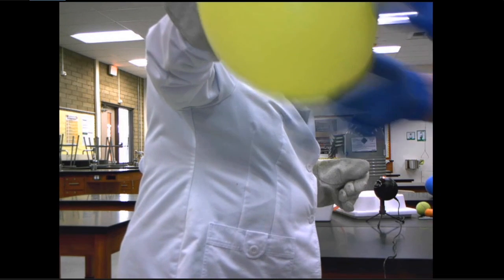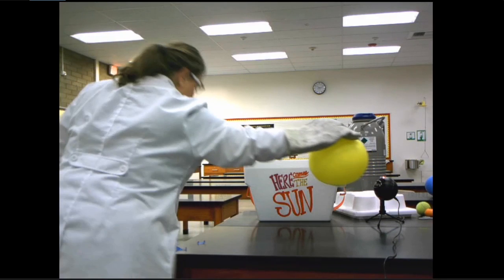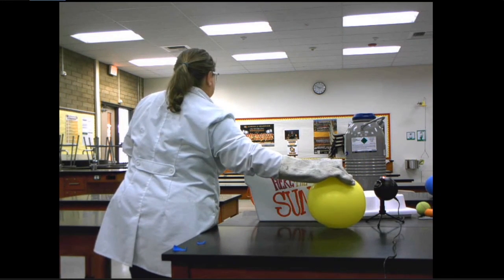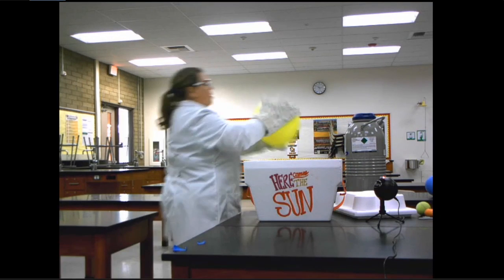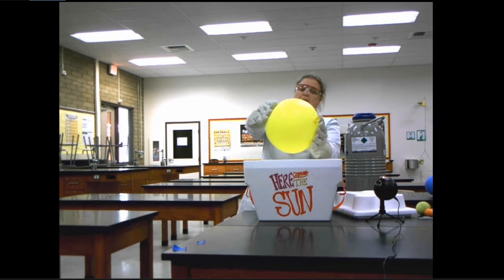And as we hold this, you can see it's starting to actually come back. So you can kind of hear it, hopefully. It's coming back. It's actually what is changing now. And here's the crackling of some of that liquid air, okay? And now I've got, again, a nice bouncy balloon. So how did that happen? How did it come back to being now my big bouncy balloon? A nice bouncy balloon again, okay? Pushing on the edges. Now I'm going to put it in again to the liquid nitrogen.